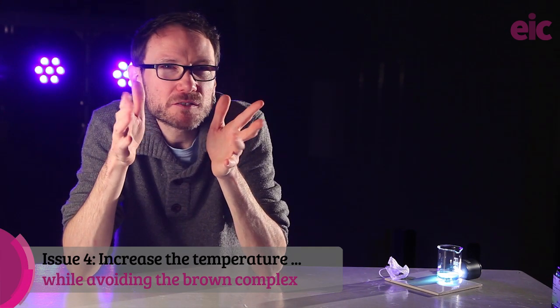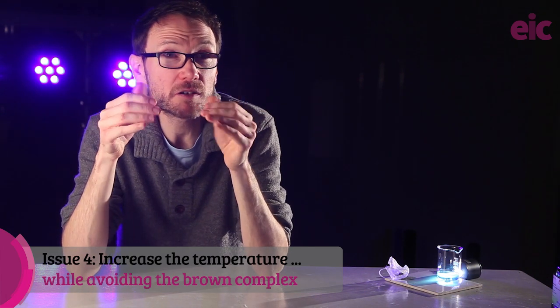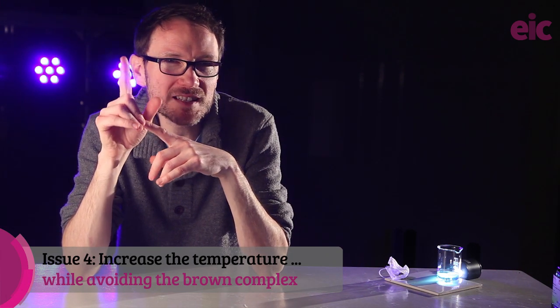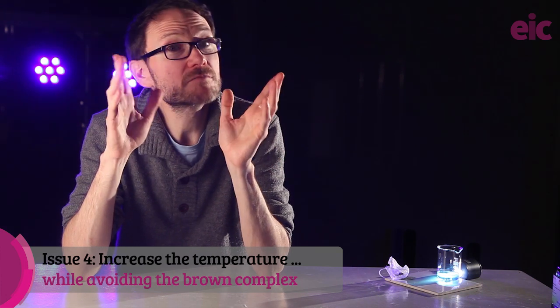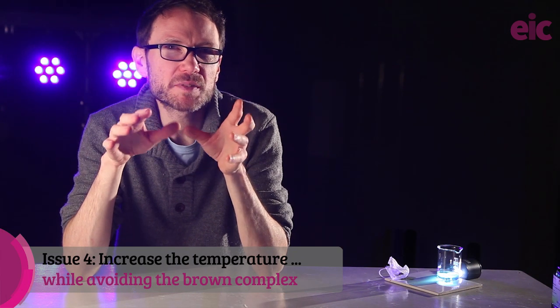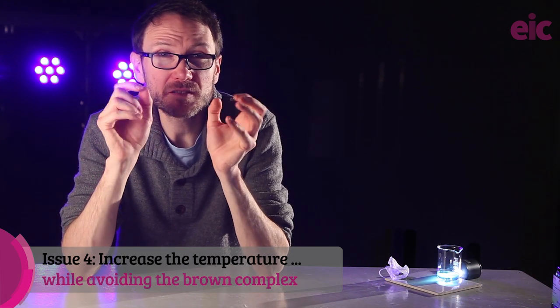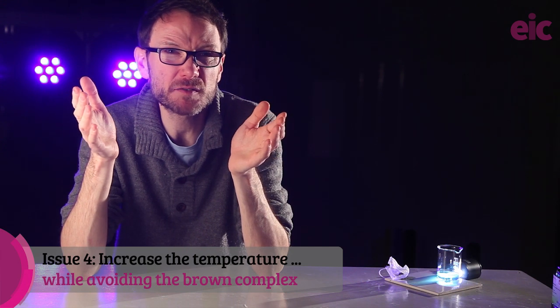Clearly, having a little bit of extra acid kicking around is not such a bad thing, especially if you're going to heat up the reaction. So I went back to the original recipe, and this time, instead of dissolving in sodium hydroxide, I dissolved directly in acid. You do need to be more patient this way. Crushing up little clumps of red powder with a stirring rod will help, but you definitely don't want to be trying to dissolve this in front of the class. It takes a few minutes.